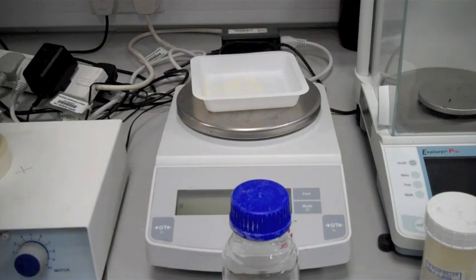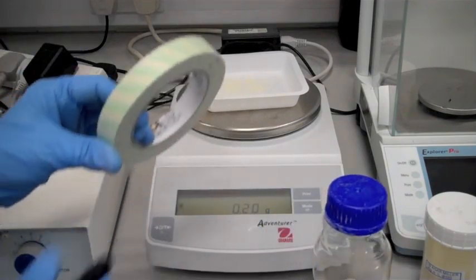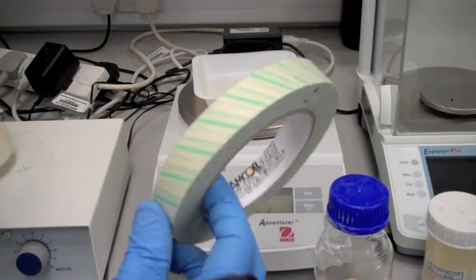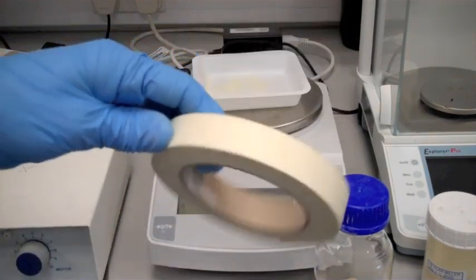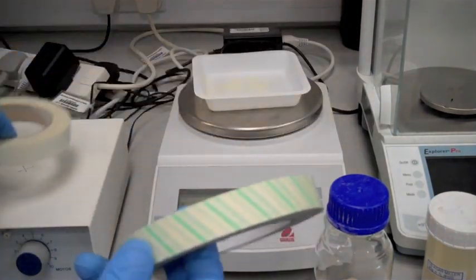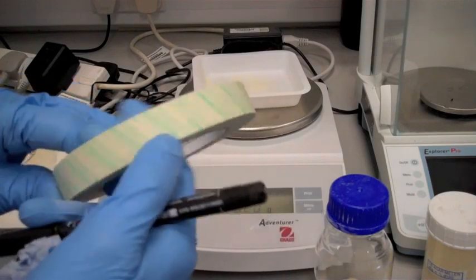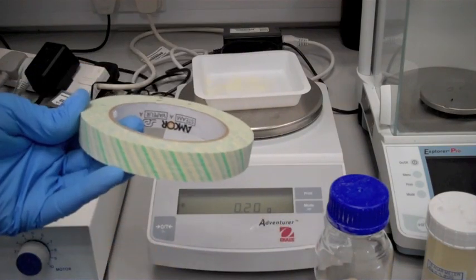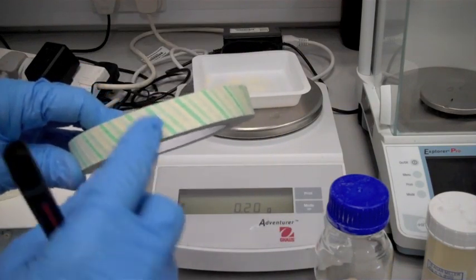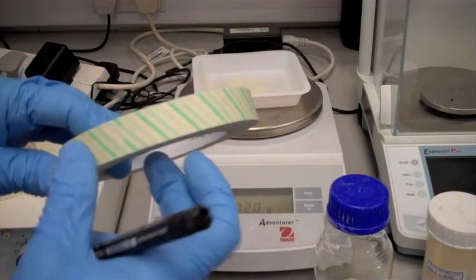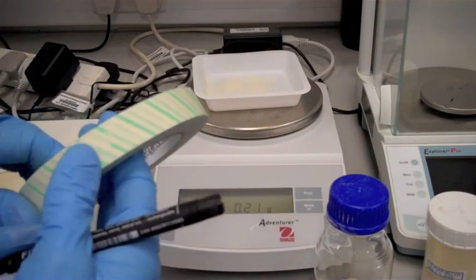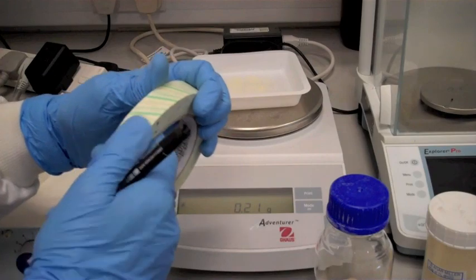And take some what's referred to as autoclave tape. We have two types of autoclave tape. We have this one here, the green one, or the slightly light one. This has stripes along, which when subjected to high temperatures in the autoclave, these stripes will turn black to tell you that the autoclave has worked efficiently.